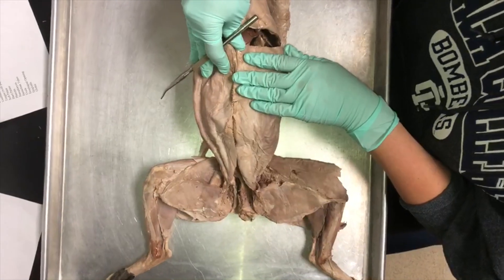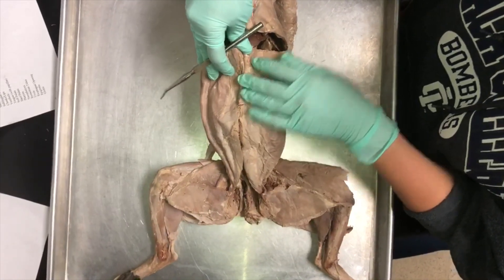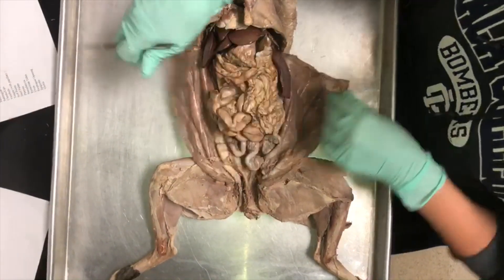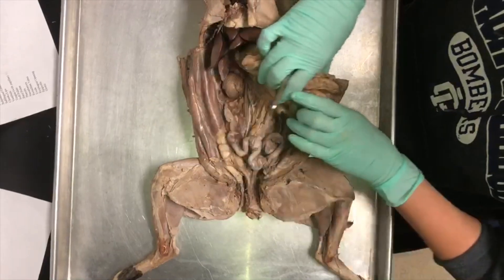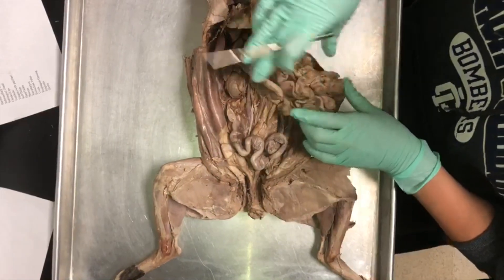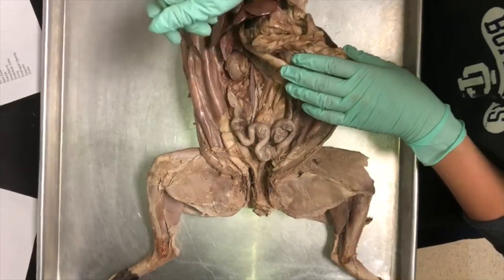We're going to review the deep urogenital anatomy of the female cat. First, you're going to want to pull your intestines over to one side to expose this area of the cat.